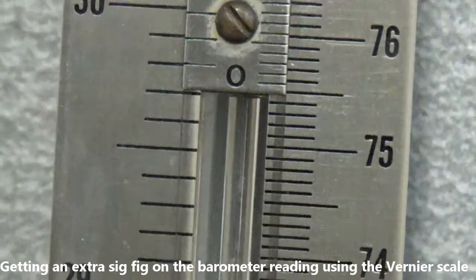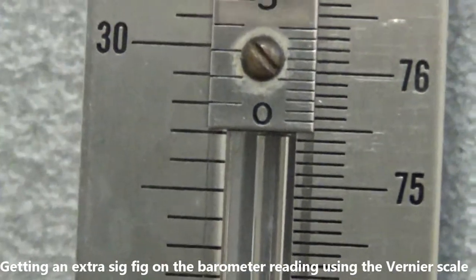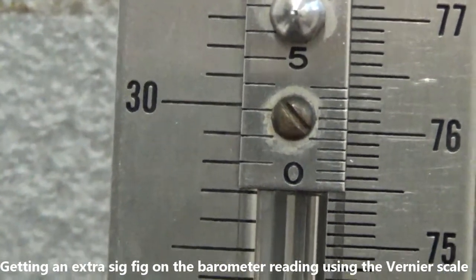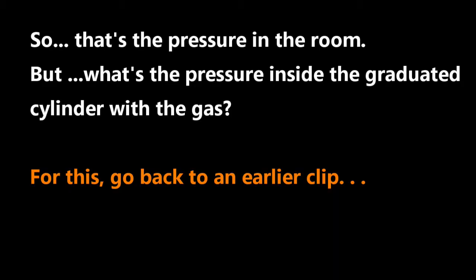So I would say it's 754.9 because it's at the 9th line where they line up. I think it's 754.9. Okay, well, that's very nice.